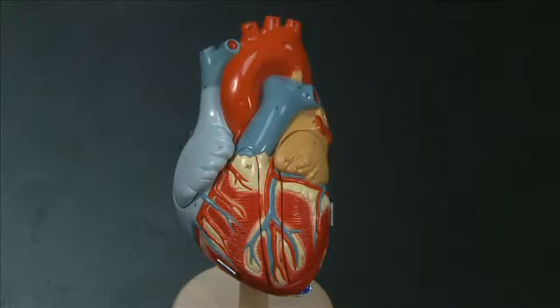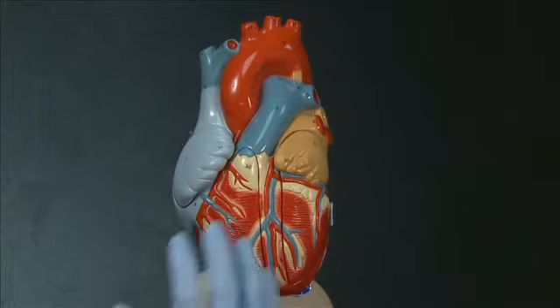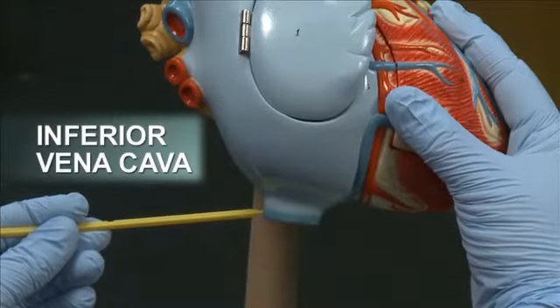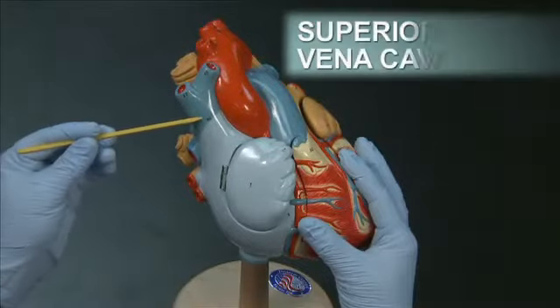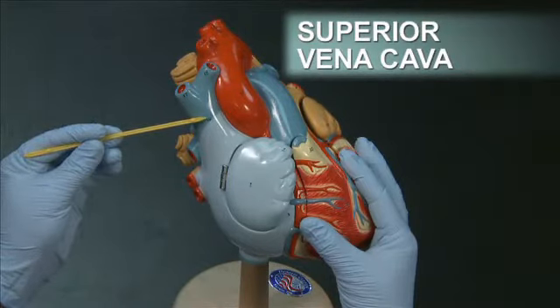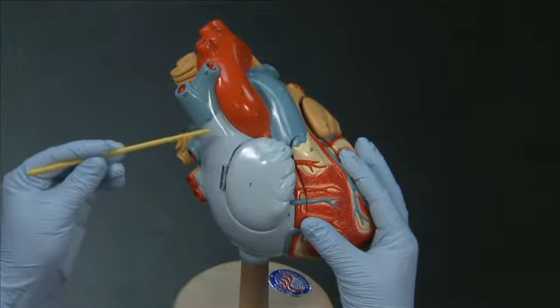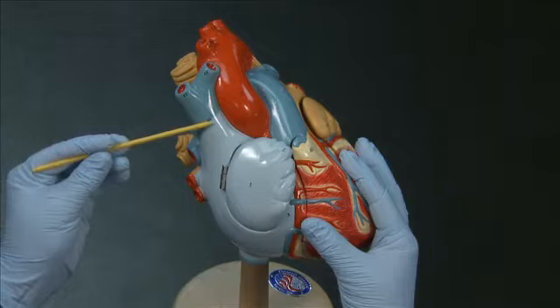Next, we'll take a look at the blood vessels entering and exiting the heart. Blood flows into the heart through the inferior vena cava and the superior vena cava, and on the model it's easy to see these vessels entering the right atrium. On the sheep heart, it might not be as obvious because sometimes these vessels are cut away.